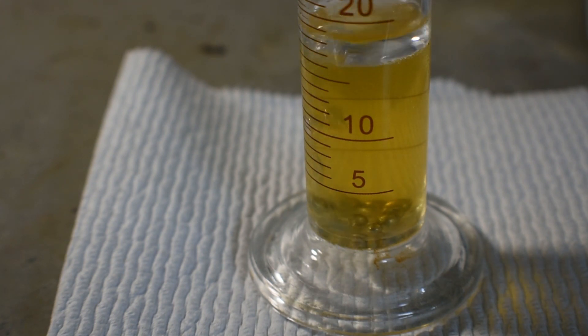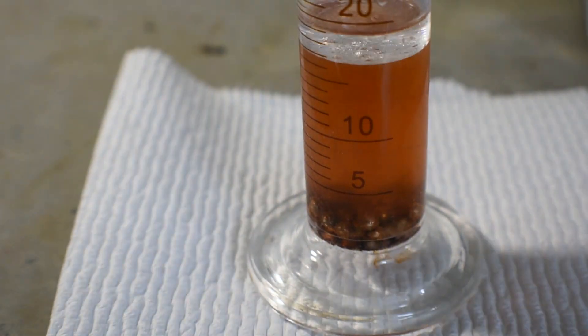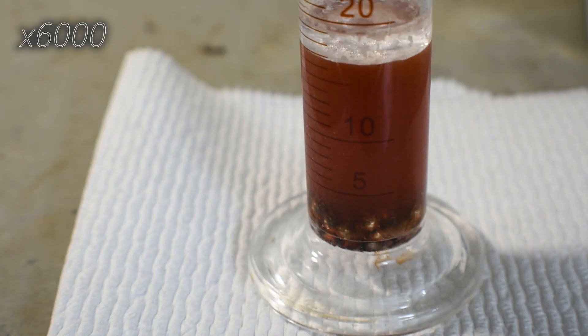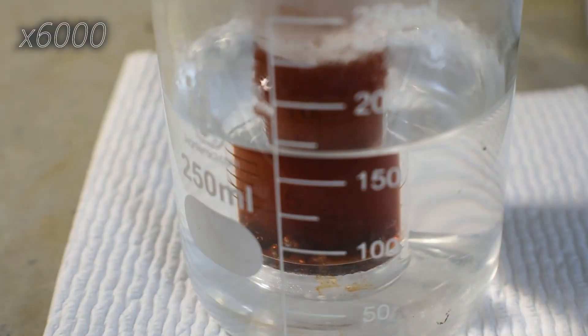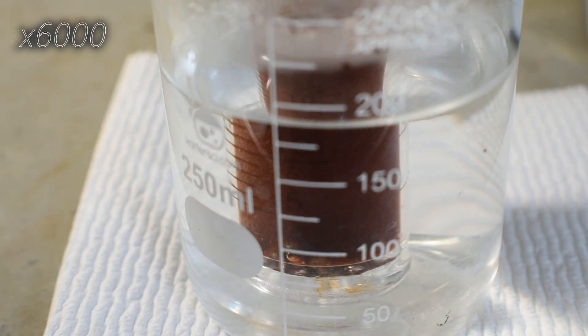We can see this as it's darkening in the color of the solution over time. Despite being safer than method 1, method 2 takes much longer. You can expect to wait about 20 minutes to see serious results.